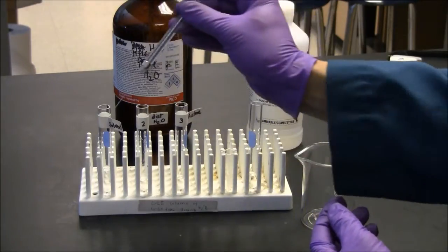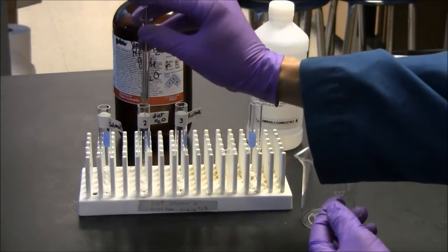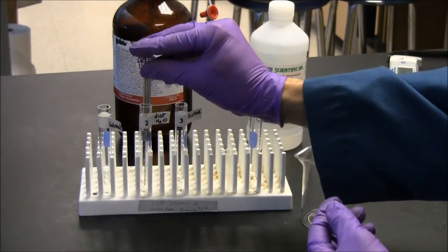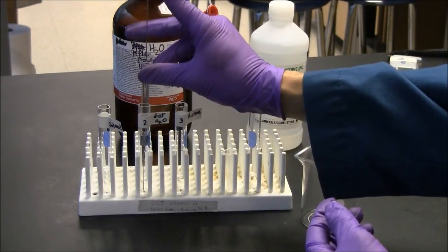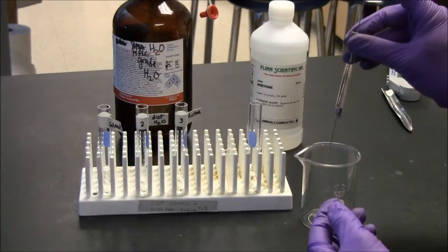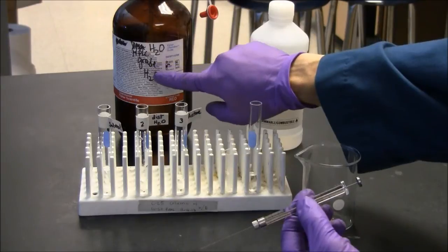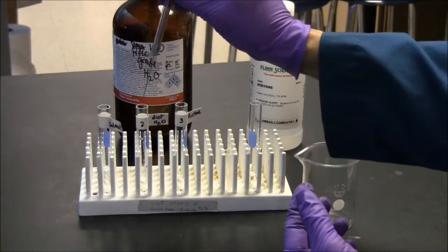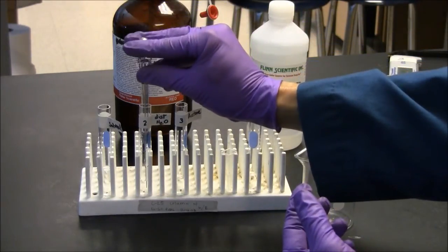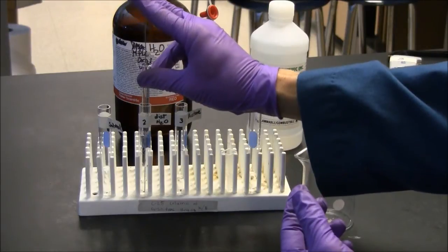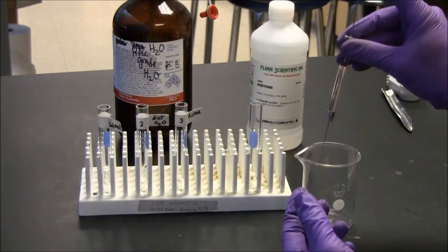All right, after I've rinsed thoroughly with that solvent, the second solvent is distilled water. You want the best quality water you can get. This vessel here has our best water, HPLC grade water. That's what I will ask you to use. And you notice we don't need a large volume of it. So the second rinse is distilled water.